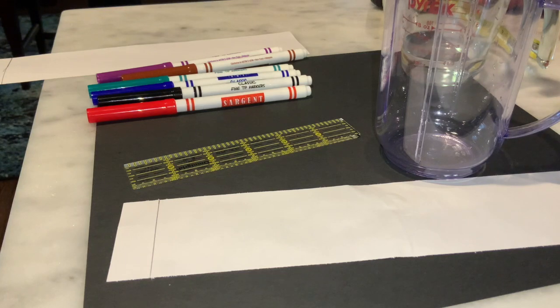Part of this week's experiment we're going to be taking a look at paper chromatography. Up to this point you should have seen some videos describing what paper chromatography is, how we would go about setting up a chromatography experiment.